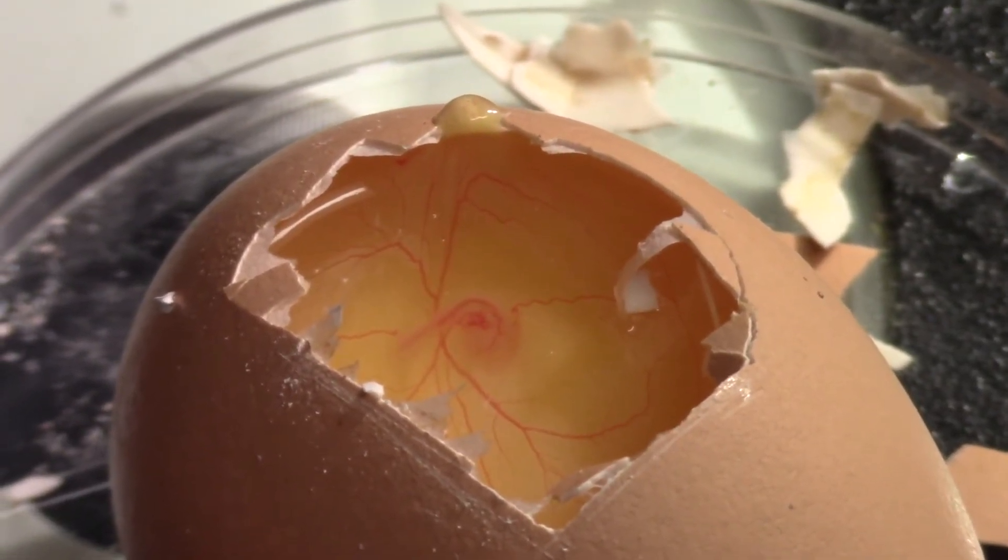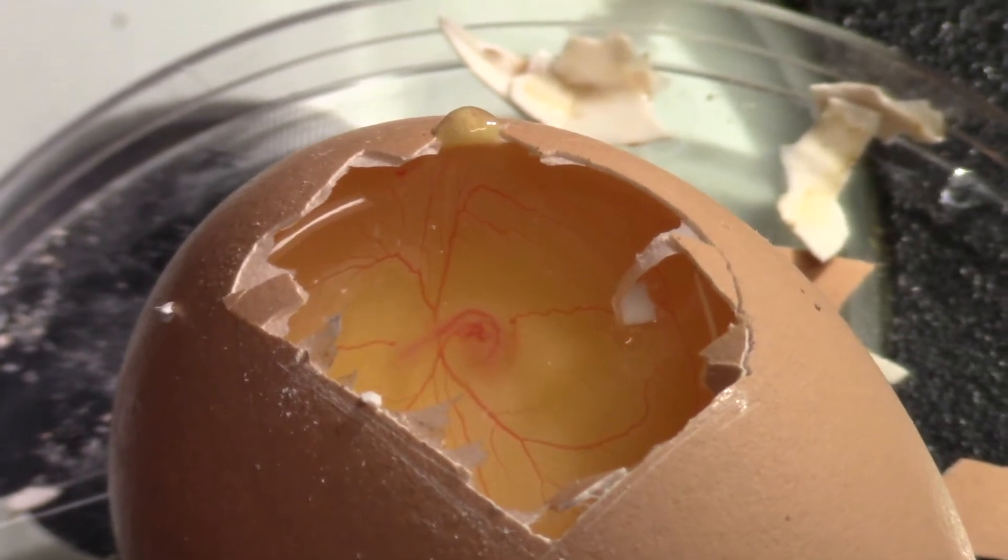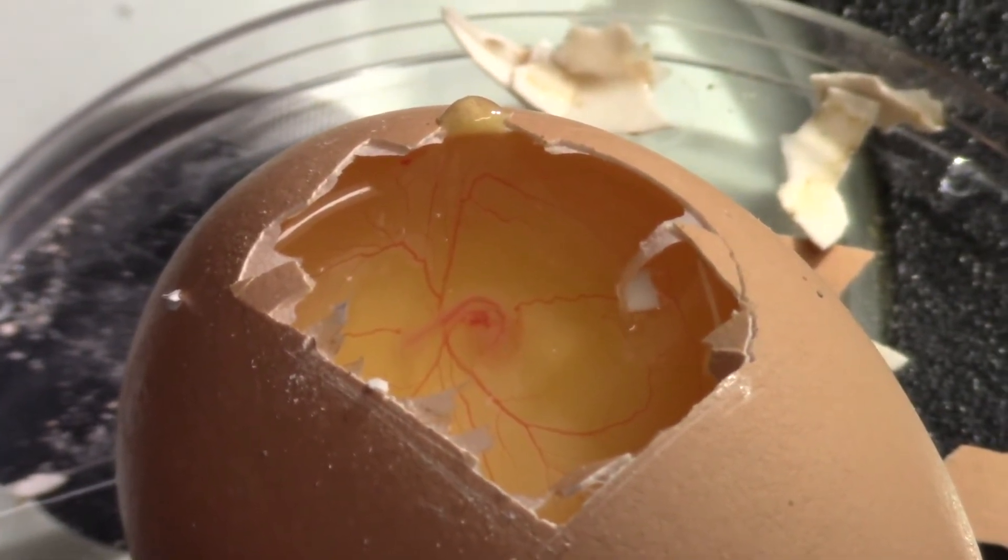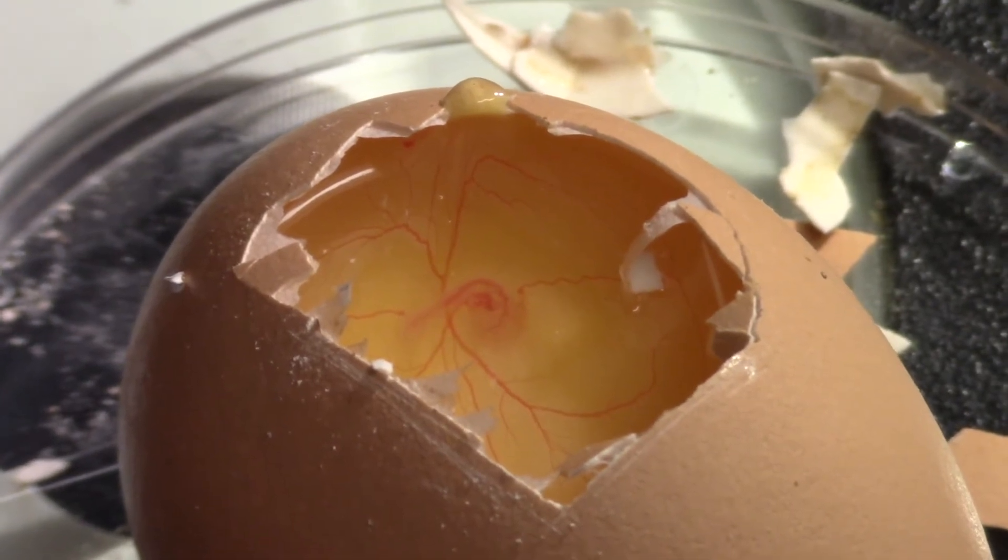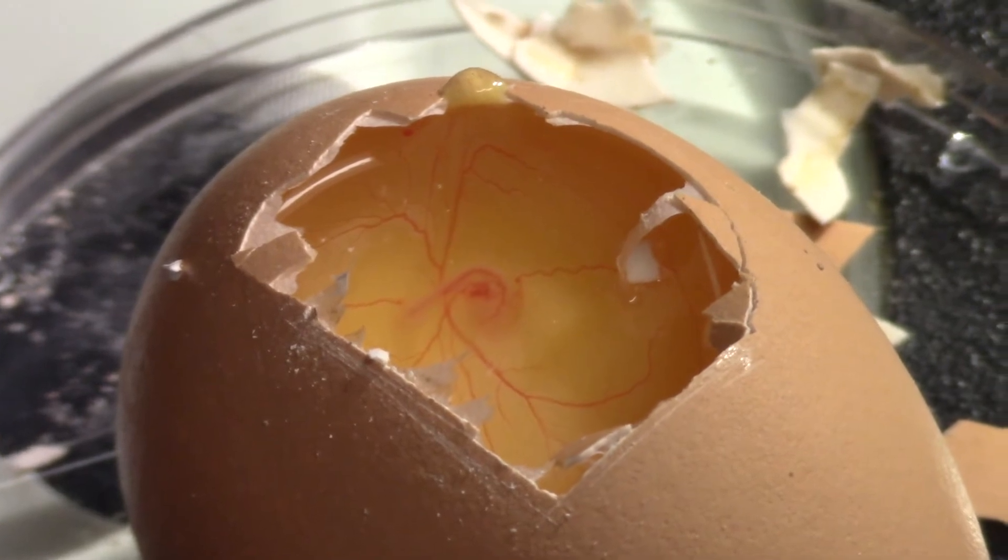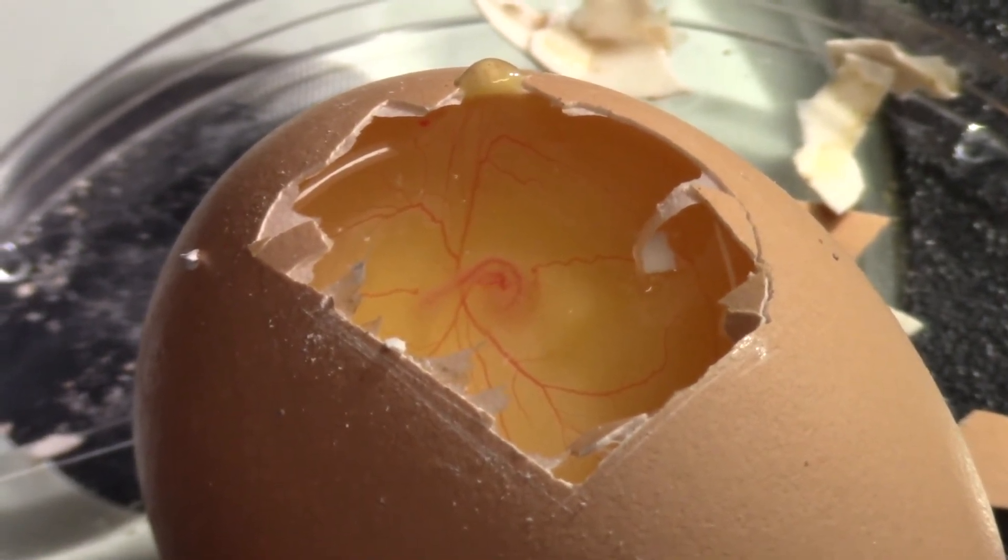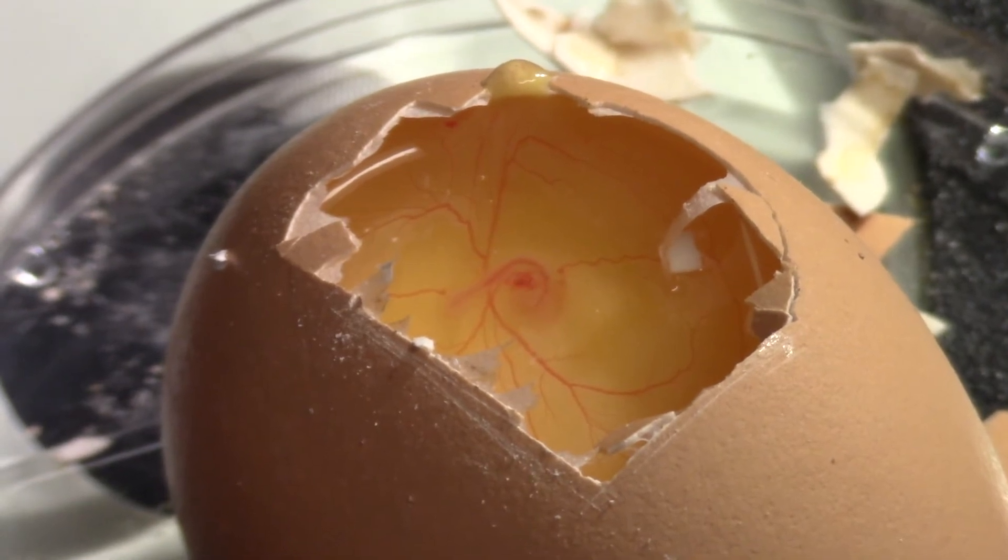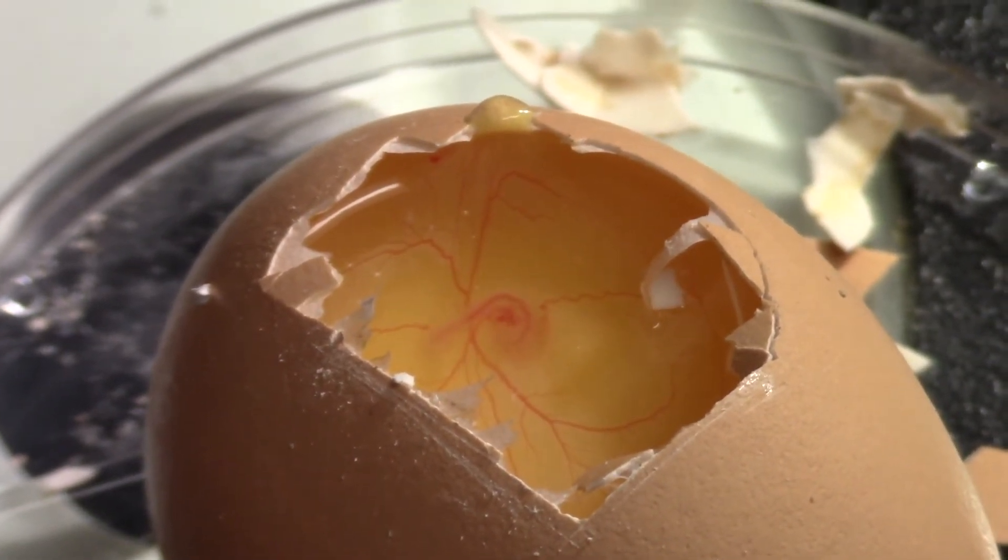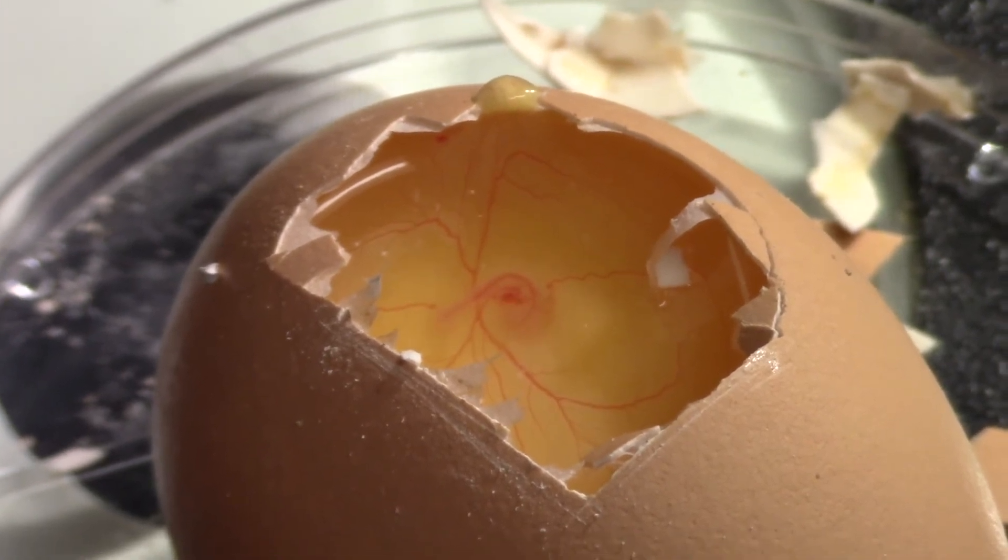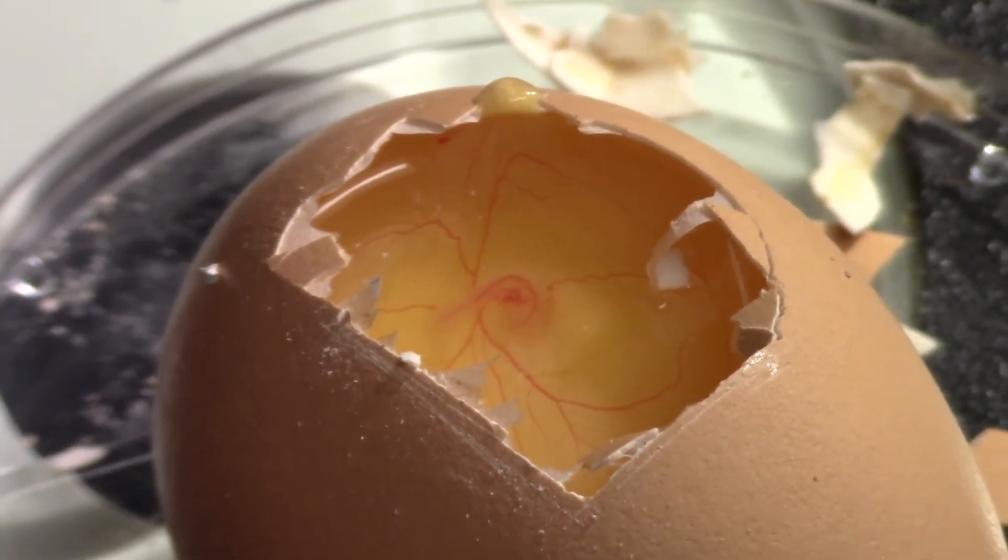So this is the embryo, just what it looks like after I've enlarged the window, so that we can see down and see the blood vessels going off to the top and to the bottom. There's a letter P laying down with the brain going towards the bottom on the right side. The beating heart is the red pulsing right in the center. And then the body of the embryo bends around that and goes directly to the left, just like a little inverse question mark.